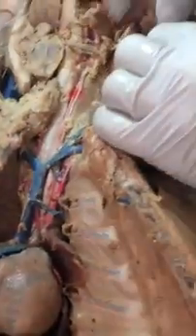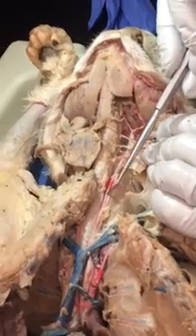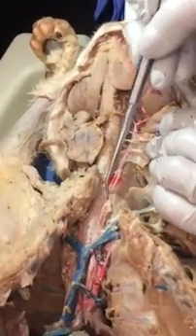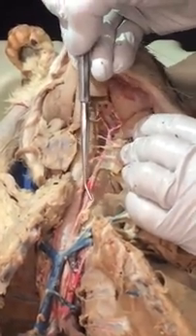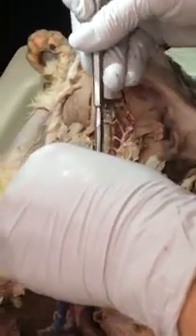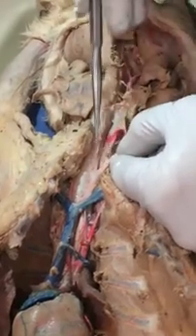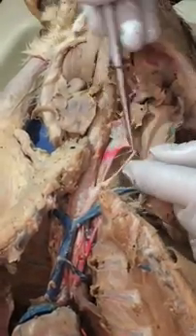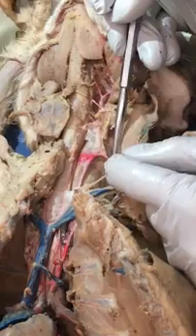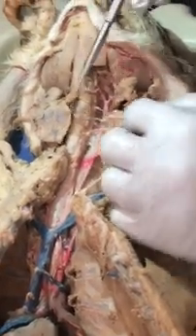You're doing arteries? Or what? Okay, so let me take a look at this cat. We're following the common carotid artery, and notice the cord right next door to it. What's the name of this cord that's running with the carotid artery? Is that the vagus? Vagus nerve. Everybody see the vagus nerve right here? Kind of separating it away. So you see it's two. Vagus, how do you spell it? VAGUS. Good.